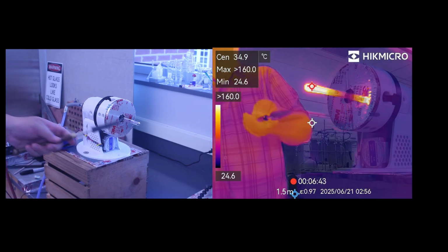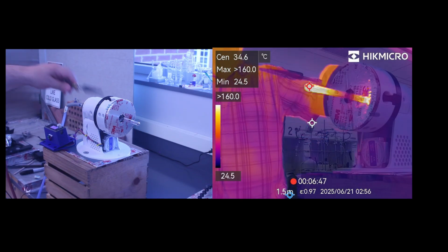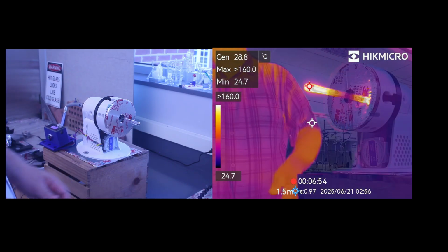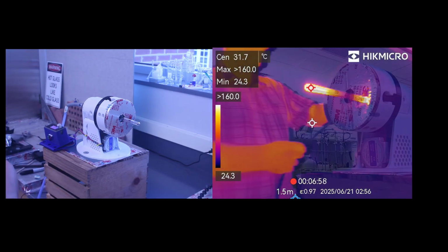A professional glass blower can make something by hand that's much better than that, basically perfect. But I am a chemist. I am not a professional glass blower. So the lathe gives us a mechanical advantage. It's a cheat code, and so take advantage of that.